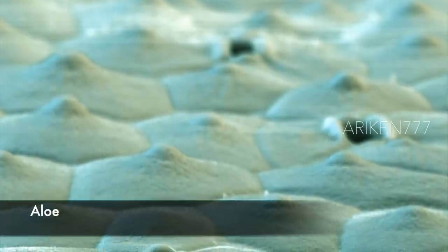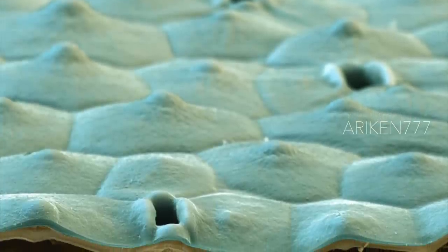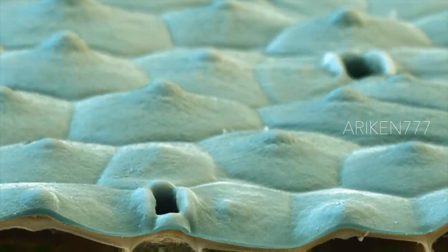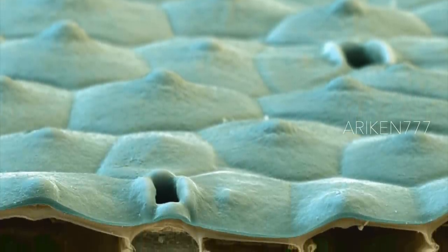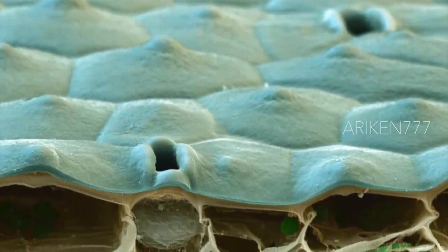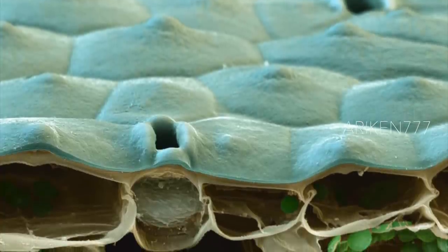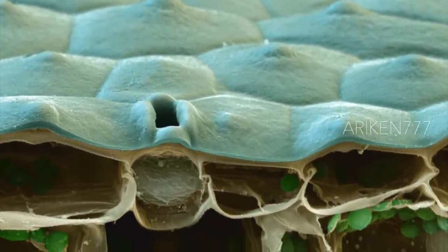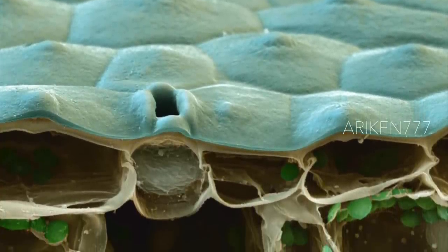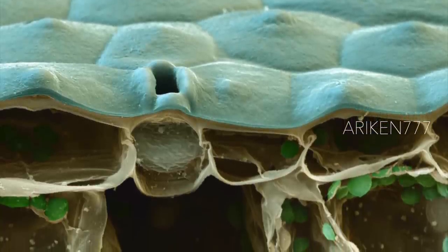This is aloe, which belongs to the lily family and possesses succulent leaves. The picture shows a pore or stomata found on the underside of the leaves of aloe plants. By opening and closing the pore, the plant regulates its vapor and metabolism. Aloe plants are known throughout the world for their medicinal uses.